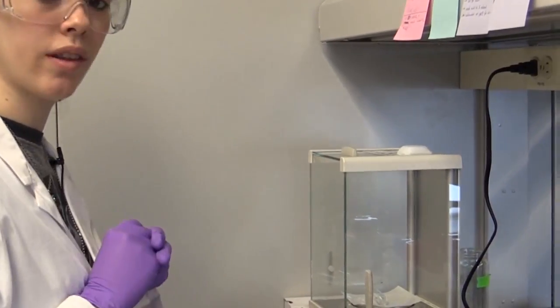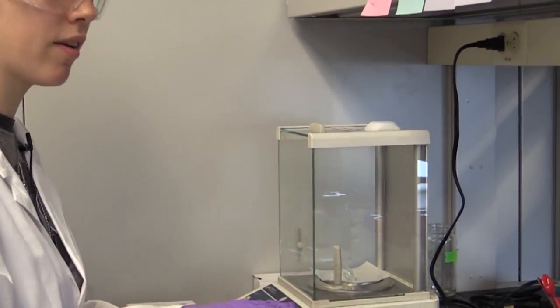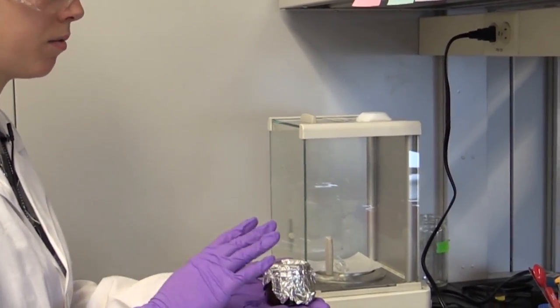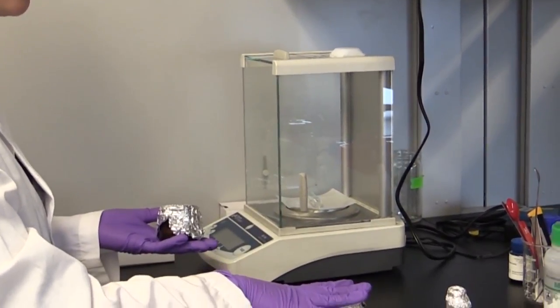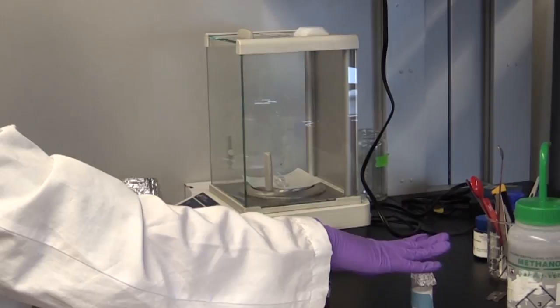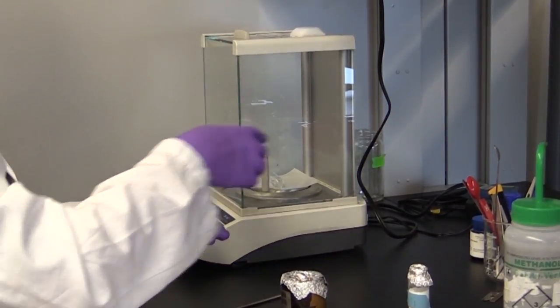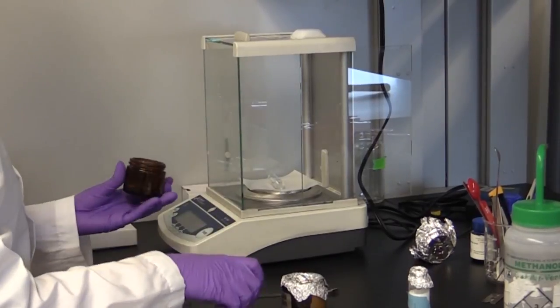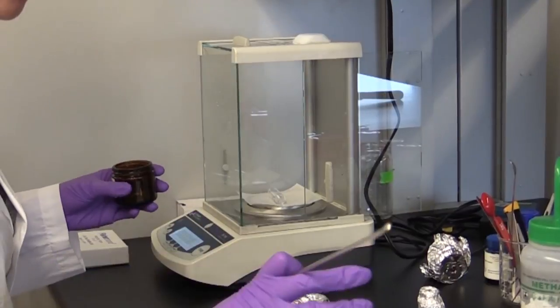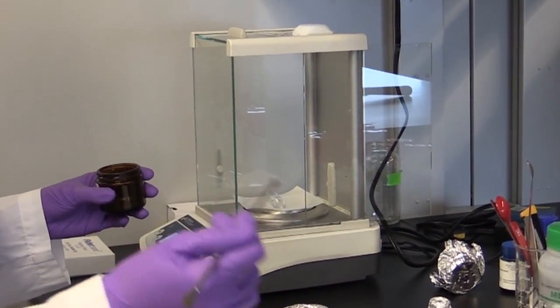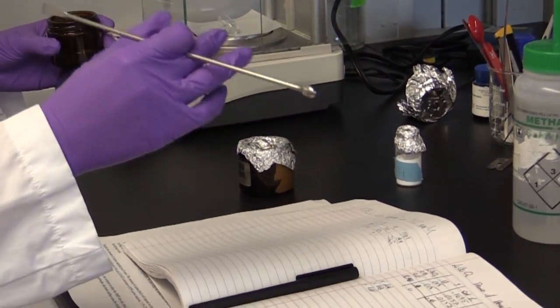We're going to need to weigh the amount of active material we'll be needing. For this particular cathode material, 85% of lithium cobalt oxide, 7.5% of carbon black, and 7.5% of PVDF will give us good properties. So that's what we'll be weighing out. You want to keep track of how much of each you weigh out so that you can properly calculate how much percent of your cathode will be the active material.